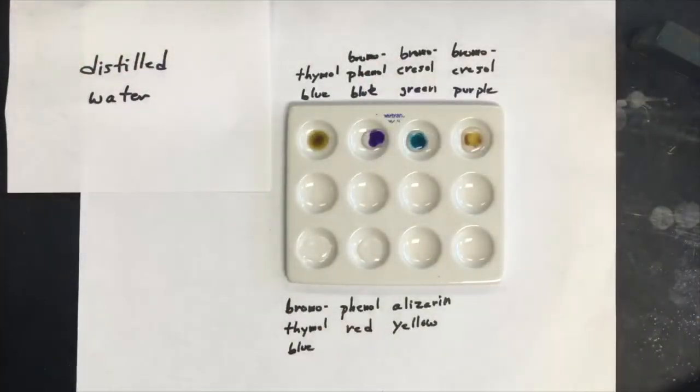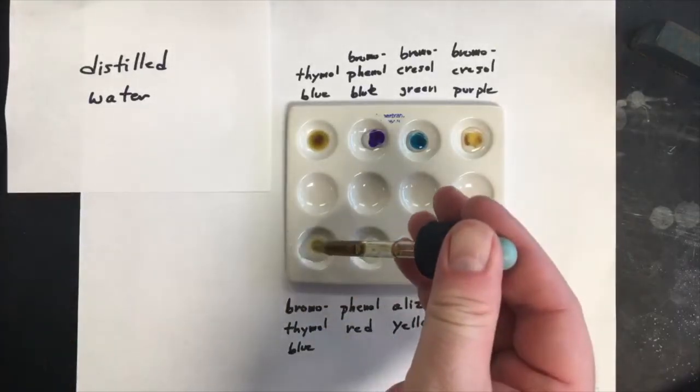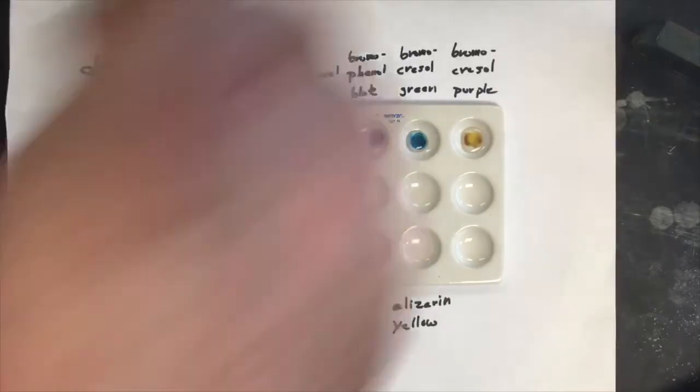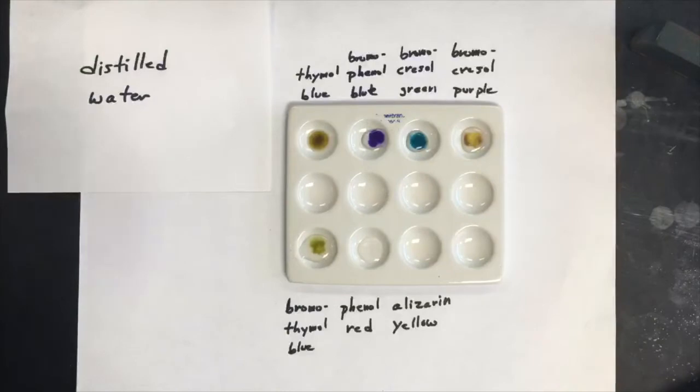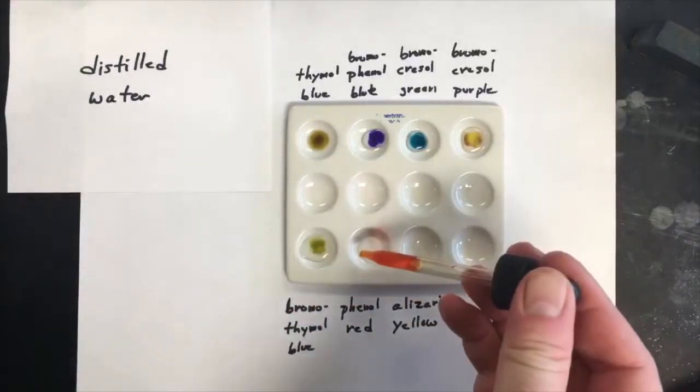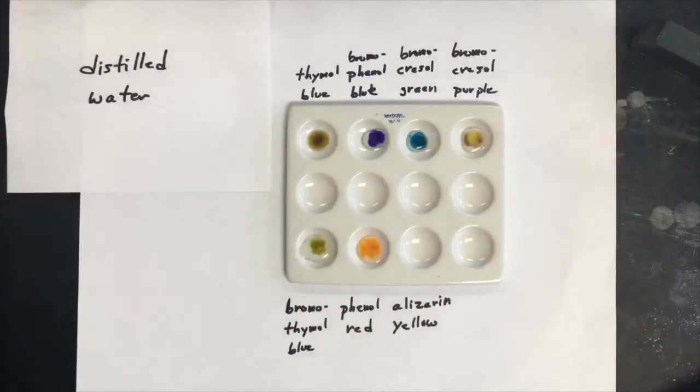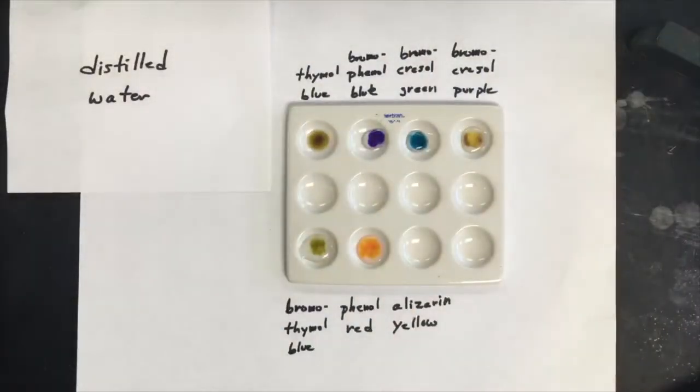Bromothymol blue. And then alizarin yellow. I think that's how you say it.